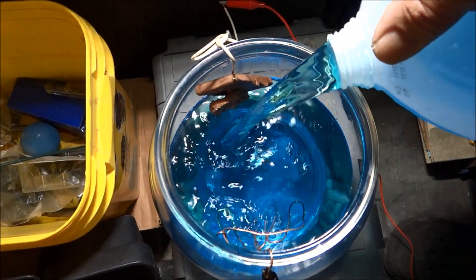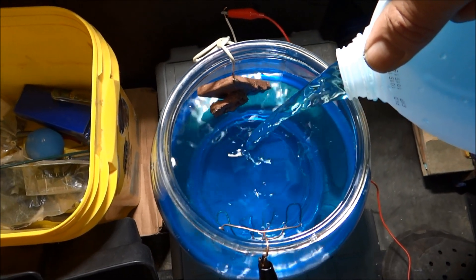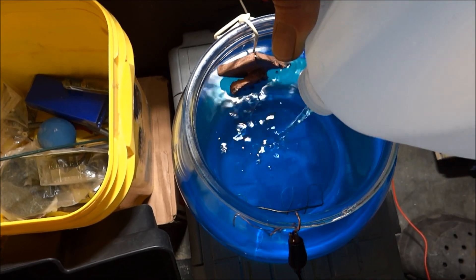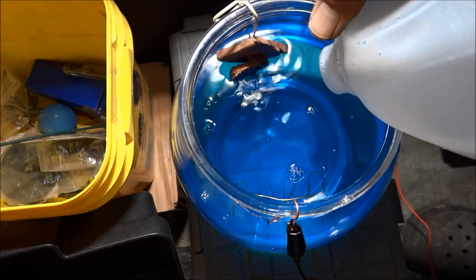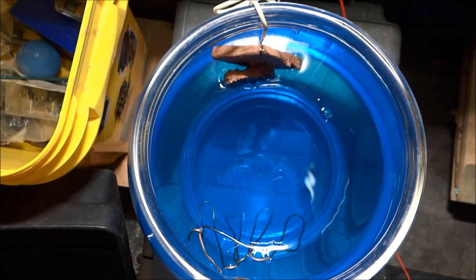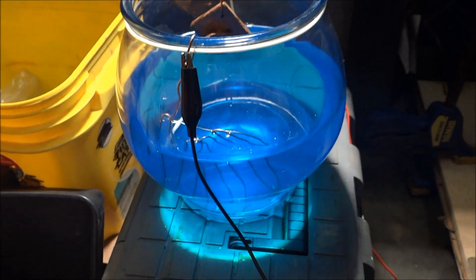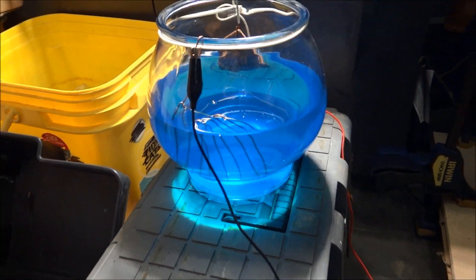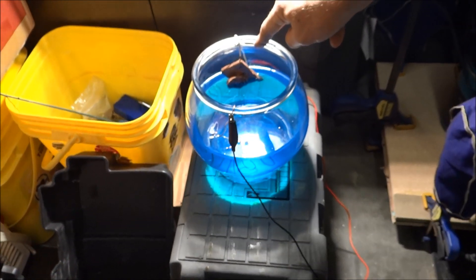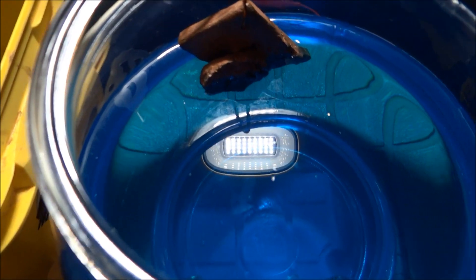You don't want your copper hitting the edges - because it's all about conducting electricity and you don't want it running all the way around the edges. Wow, look at that. I think that's probably enough. Now we're going to plug it into the battery. I haven't used it with the battery like this before. That wire is going to suck all the copper out of that bar over to the wire, and then the impurities of the copper are going to fall down to the bottom.